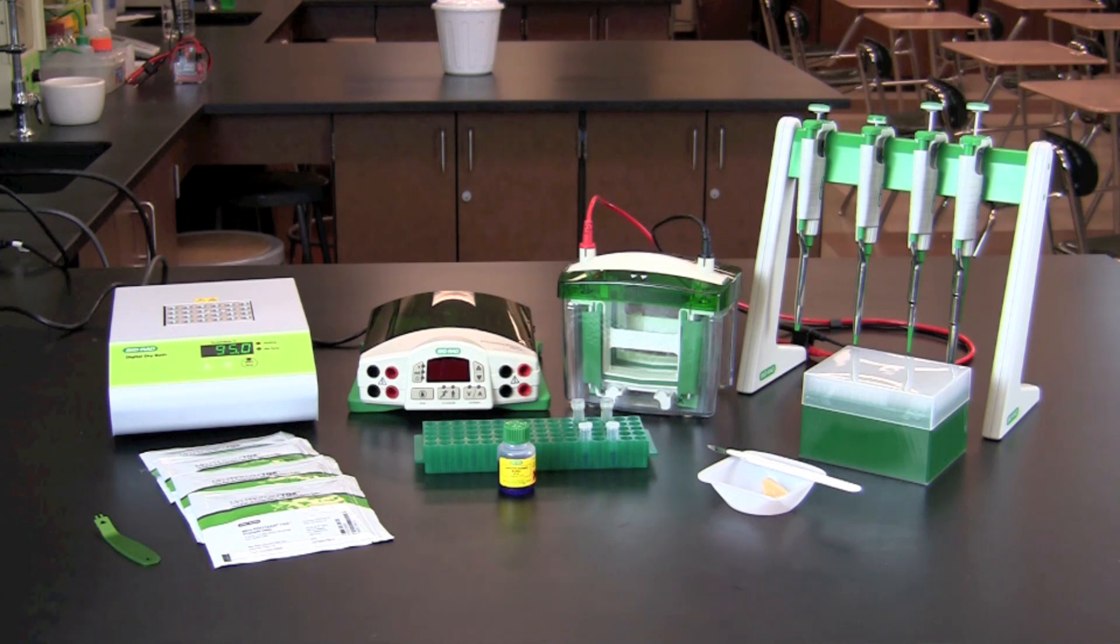In this video, you will learn how to perform SDS PAGE of fish muscle. Polyacrylamide gel electrophoresis, or PAGE, will be used to separate the proteins from fish muscle cells.